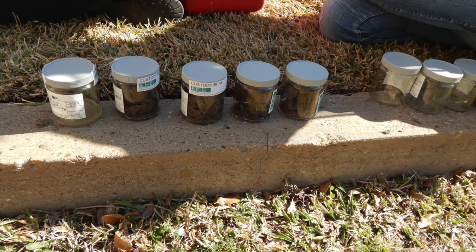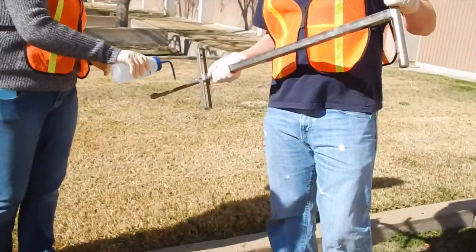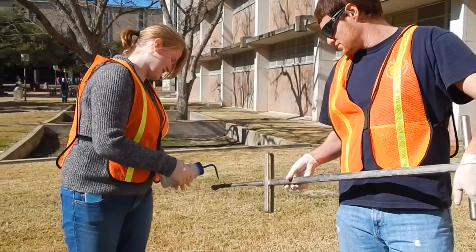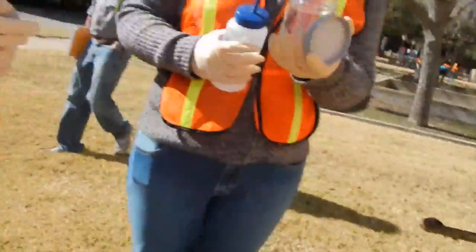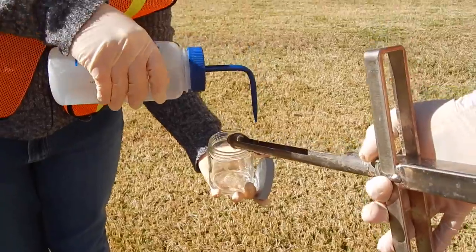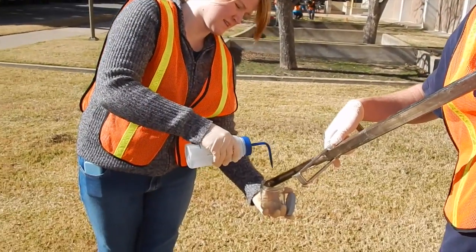There are 2 primary potential problems associated with soil sampling: cross-contamination of samples and improper sample collection. Cross-contamination problems can be eliminated or minimized through the use of dedicated sampling equipment. If this is not possible or practical, then decontamination of sampling equipment is necessary. Improper sample collection can involve using contaminated equipment, improper labeling, disturbance of the matrix resulting in compaction of the sample, or inadequate homogenization of the samples where required, resulting in variable, non-representative results.